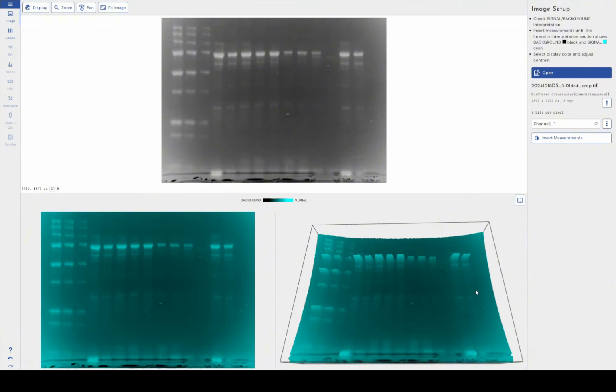So either you have to repeat your experiment, which may not be possible if you've used the last of your sample, if it was a particularly expensive or rare sample, or if you simply don't have access to the equipment anymore. What are you going to be able to do in these circumstances? Or what if your equipment has had a malfunction, and you don't have access to it anymore, and you need to replace it?